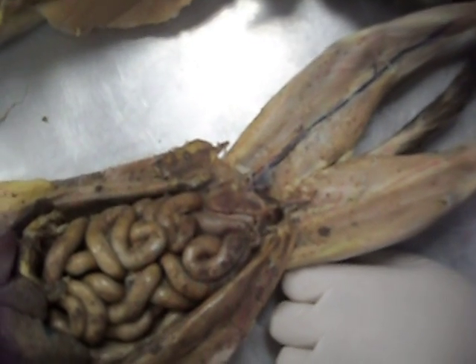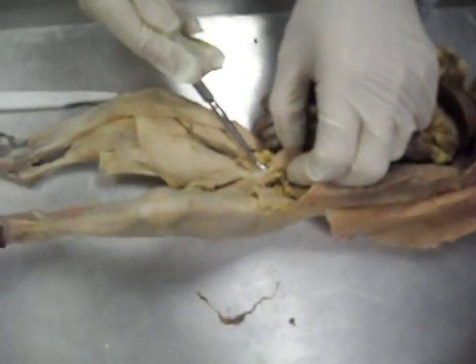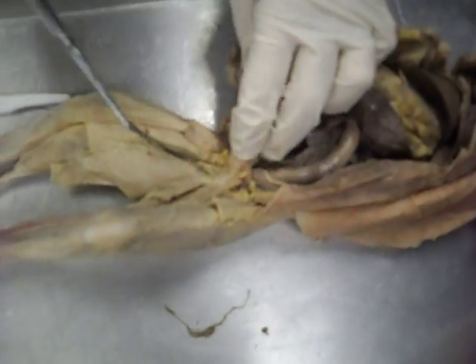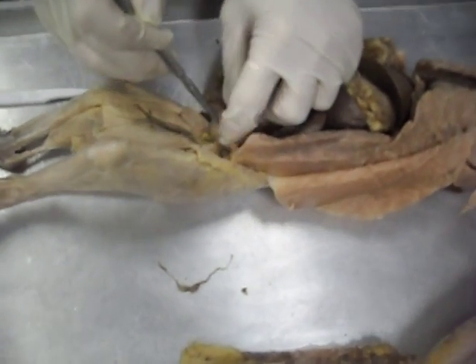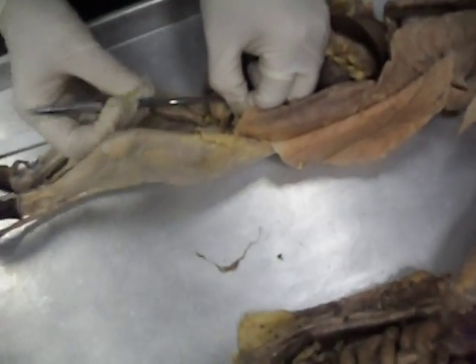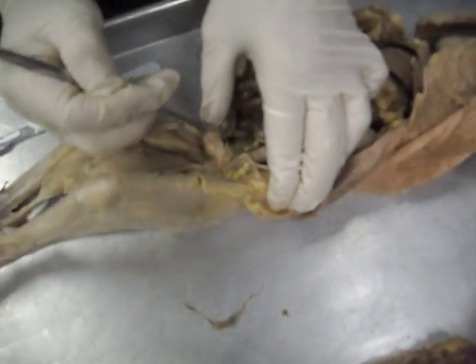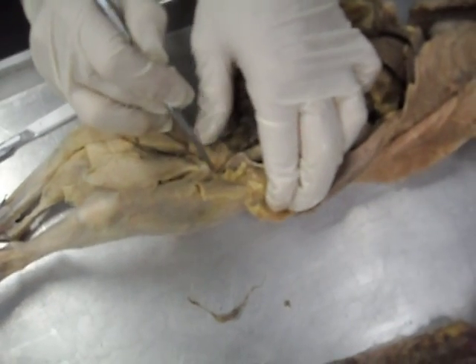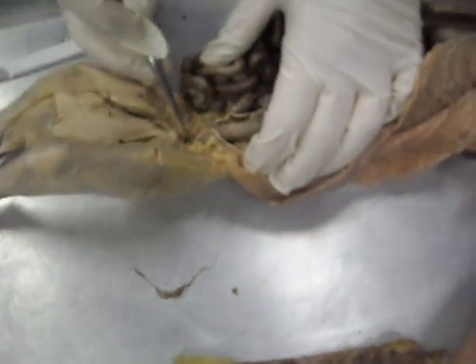And then from the urinary bladder, here is your — urethra. The urethra actually inserts — here's your vagina down here — into the vagina before it exits. So here's the vagina down here.